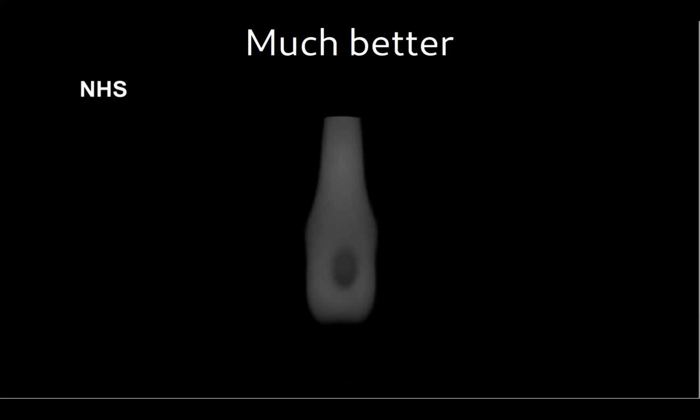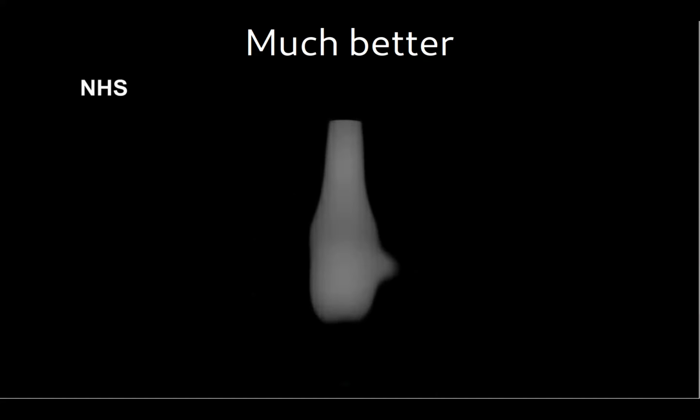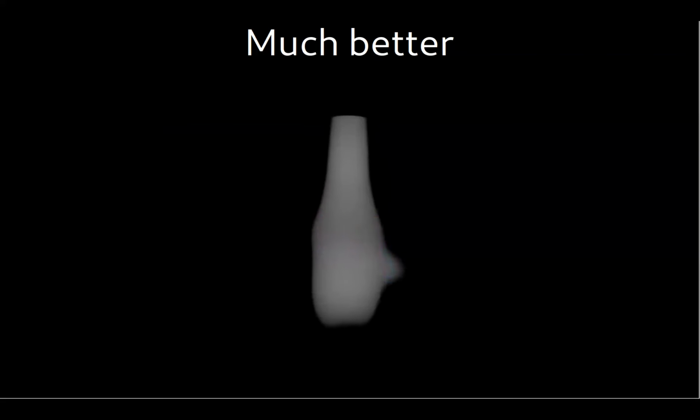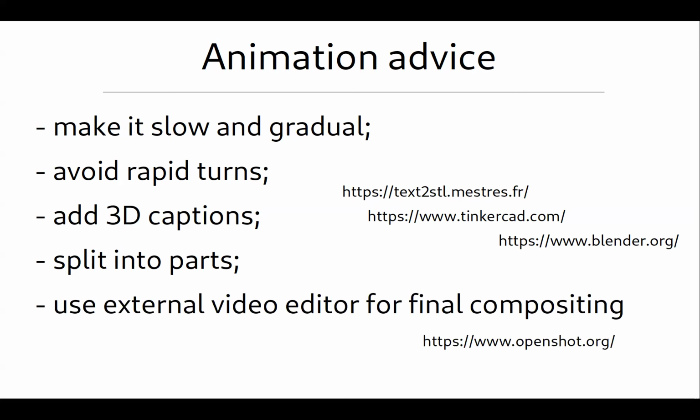This is the same data rendered by our talented PhD student later. You can see that this is much more visually pleasant and nice, right? Things show slowly, appear slowly, everything is annotated, so you don't feel like something is going on and you're missing out on everything. The other advice: I usually make different parts of the movie separately, so you don't need to deal with super long timelines. And in the end, you can use some video editors for the final compositing of things. There are some free alternatives.